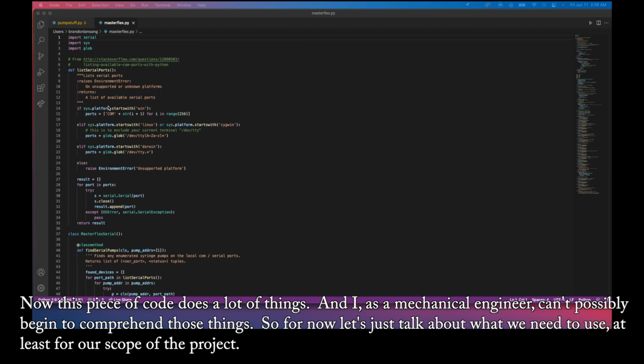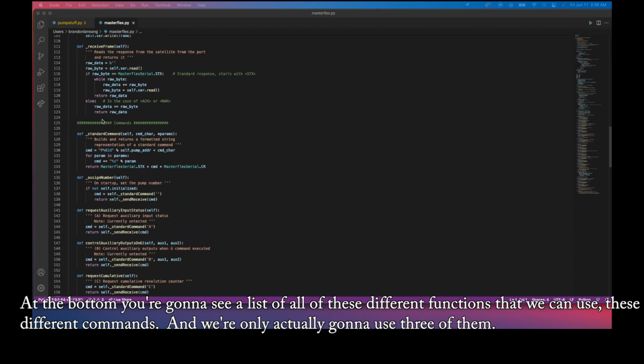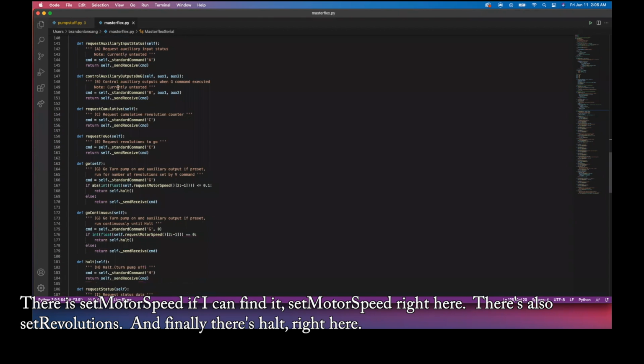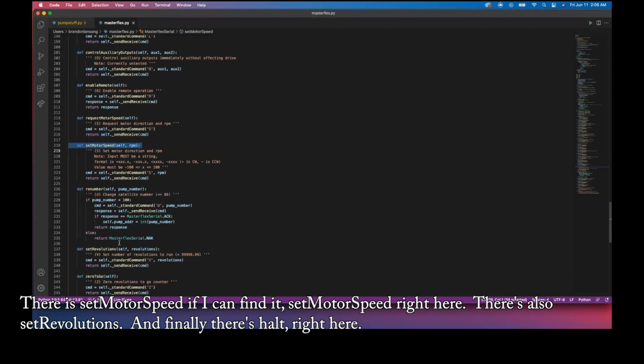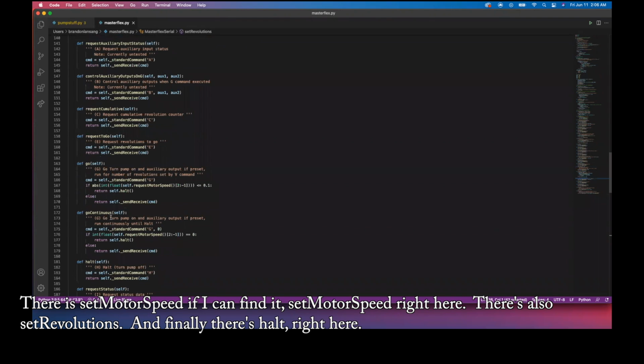of the project. At the bottom, you're going to see a list of all of these different functions that we can use, these different commands. And we're only actually going to use 3 of them. There is set motor speed, if I can find it. Set motor speed right here. There's also set revolutions. And finally, there's halt right here.